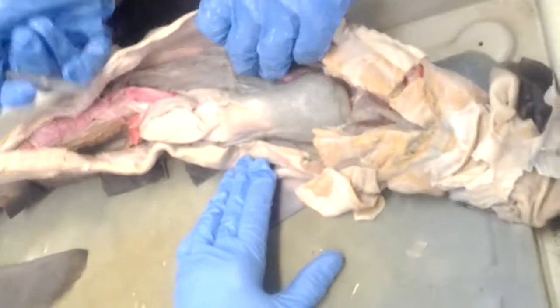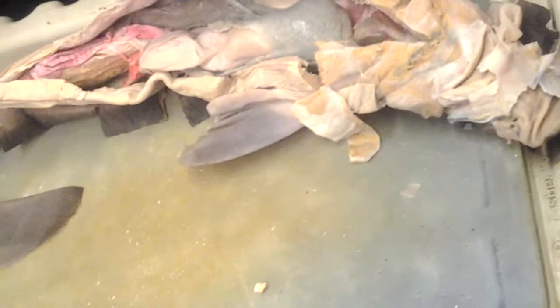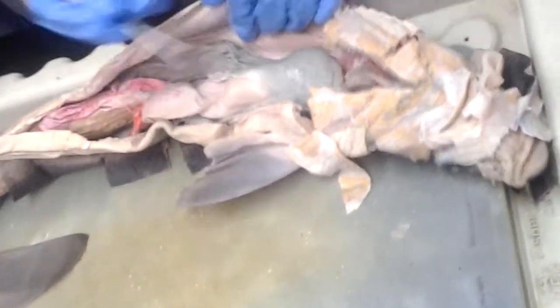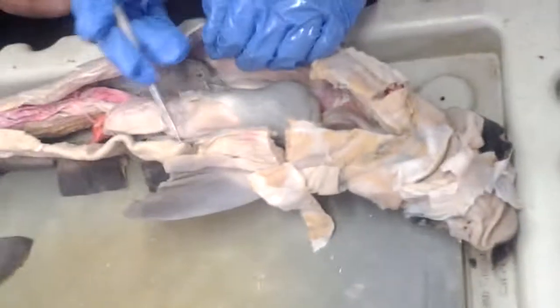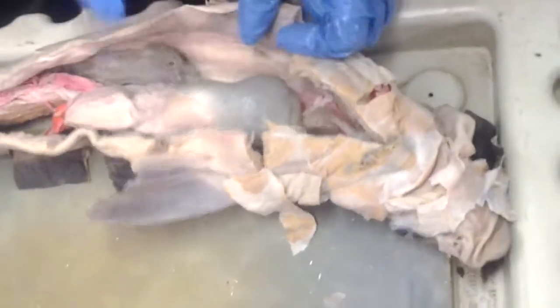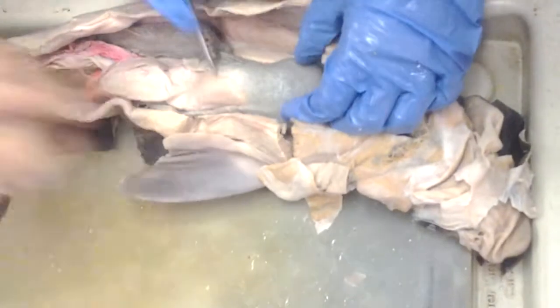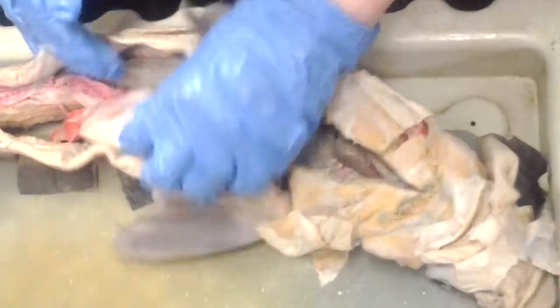Professor, I have a question. The cardiac region of the stomach is right below the liver? Pretty much, yeah. It's continuous with the esophagus. Where's the cardiac region? The top of the stomach, right there where the liver is. So this is the cardiac part here. This is the body of the stomach. This is the pyloric region.